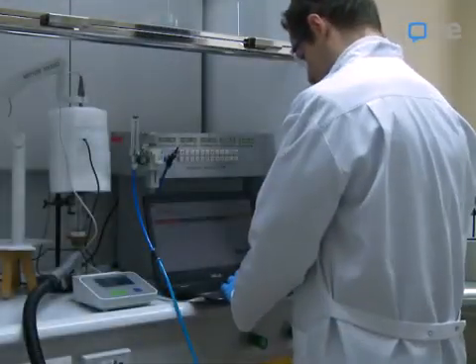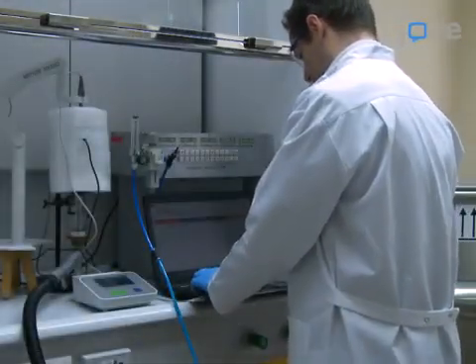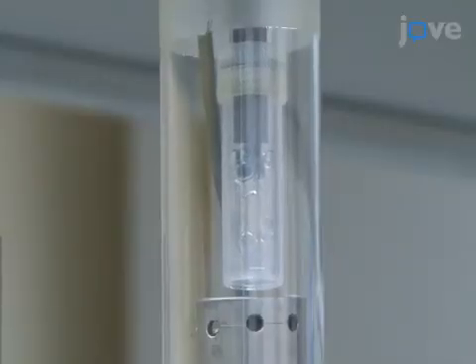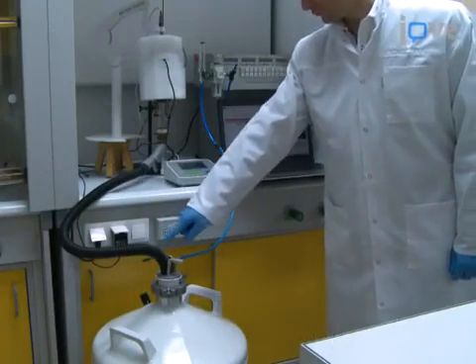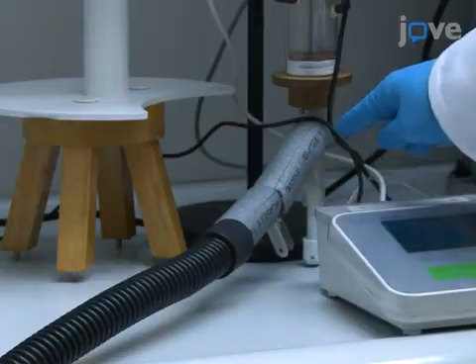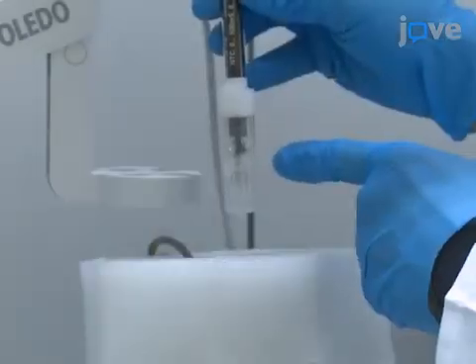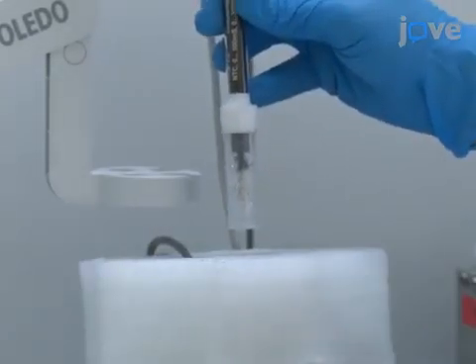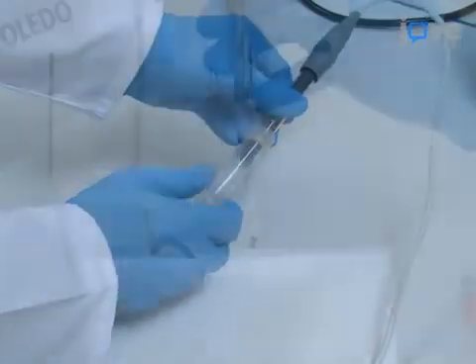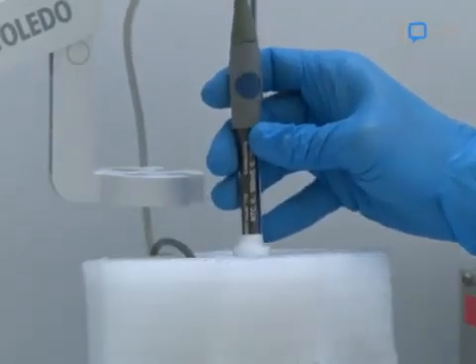Most laboratories have the equipment for a thermal scanning conductometry setup. At its core is the measurement chamber. Nitrogen gas flows into a gas dewar with a heater. The nitrogen passes through a gas mixer that is just below a sample in a polypropylene tube. The tube is attached to a conductometry sensor that is immersed in the sample.